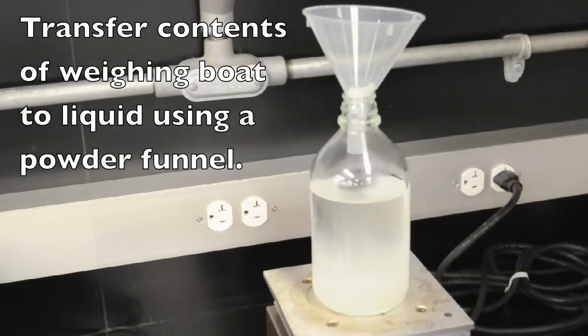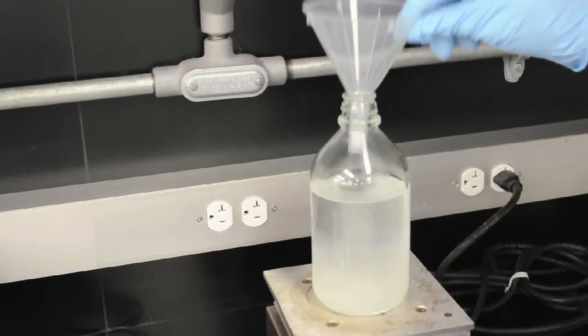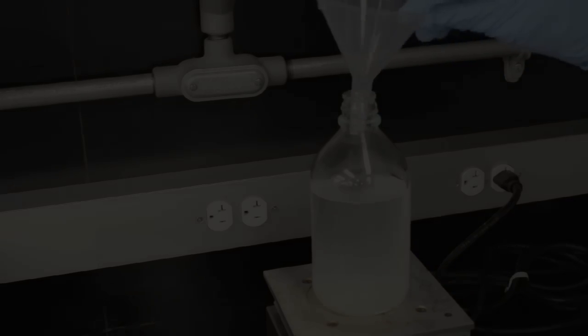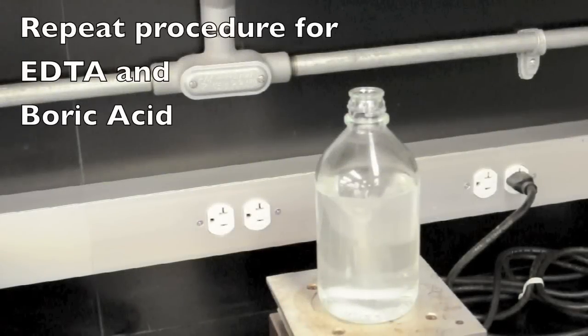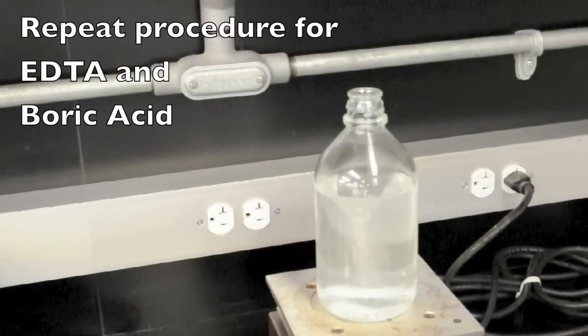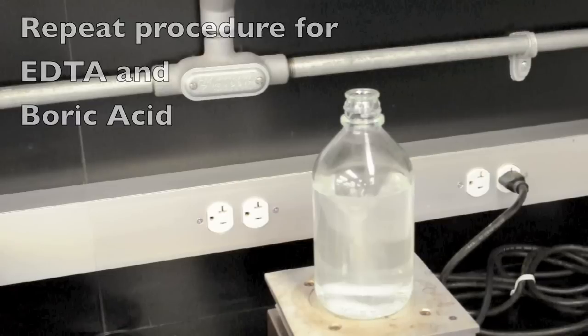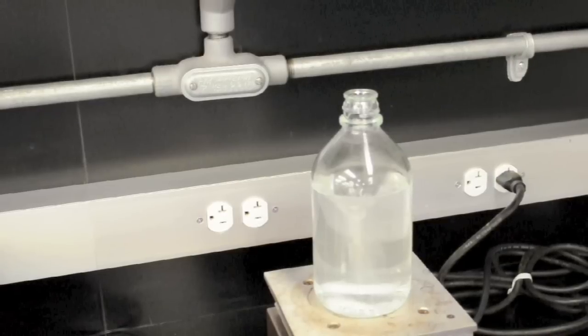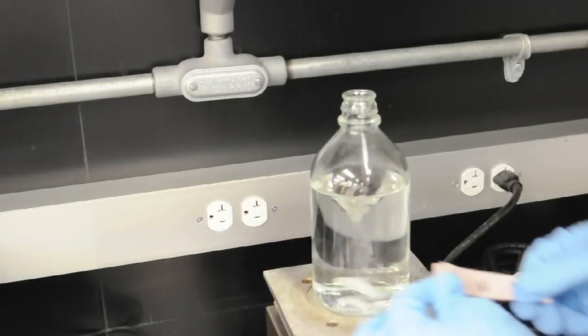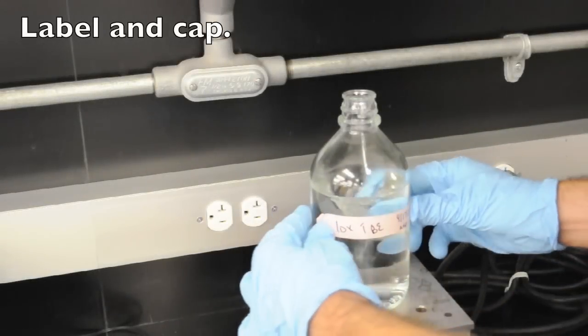We're going to then wash the funnel of course. We recycle those. We repeat this process then for EDTA and boric acid to bring the entire solution up and finally we label and cap.